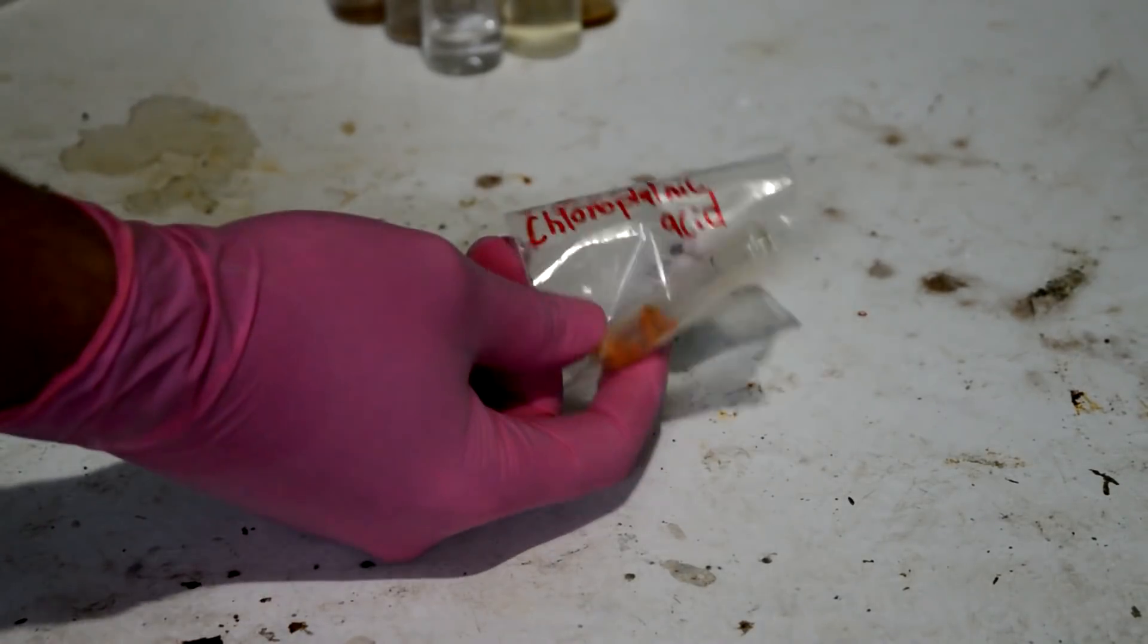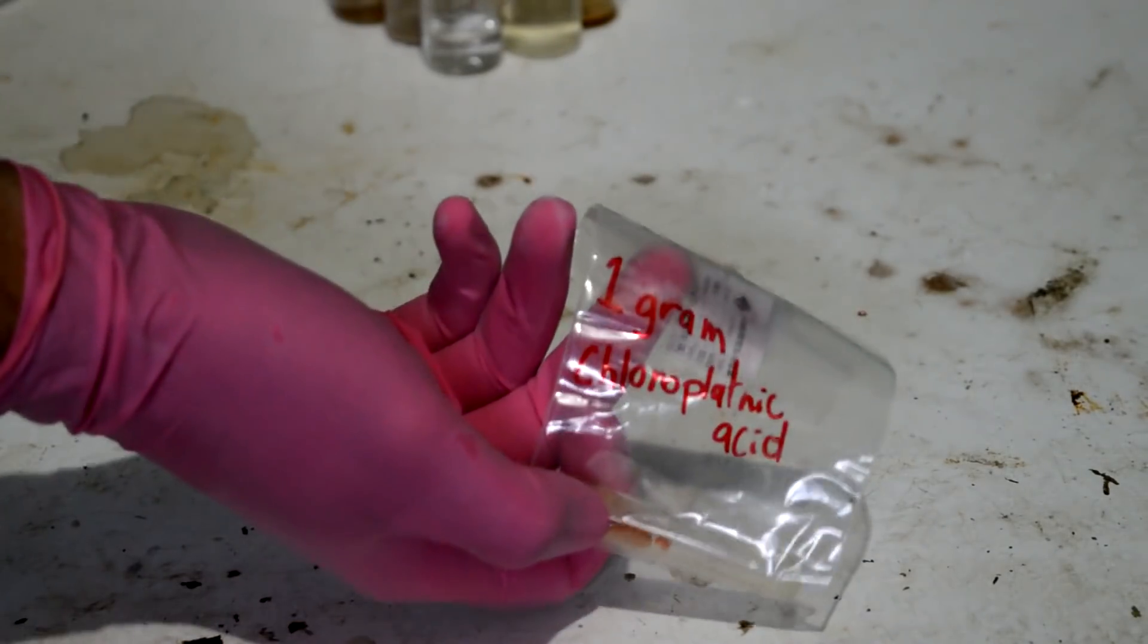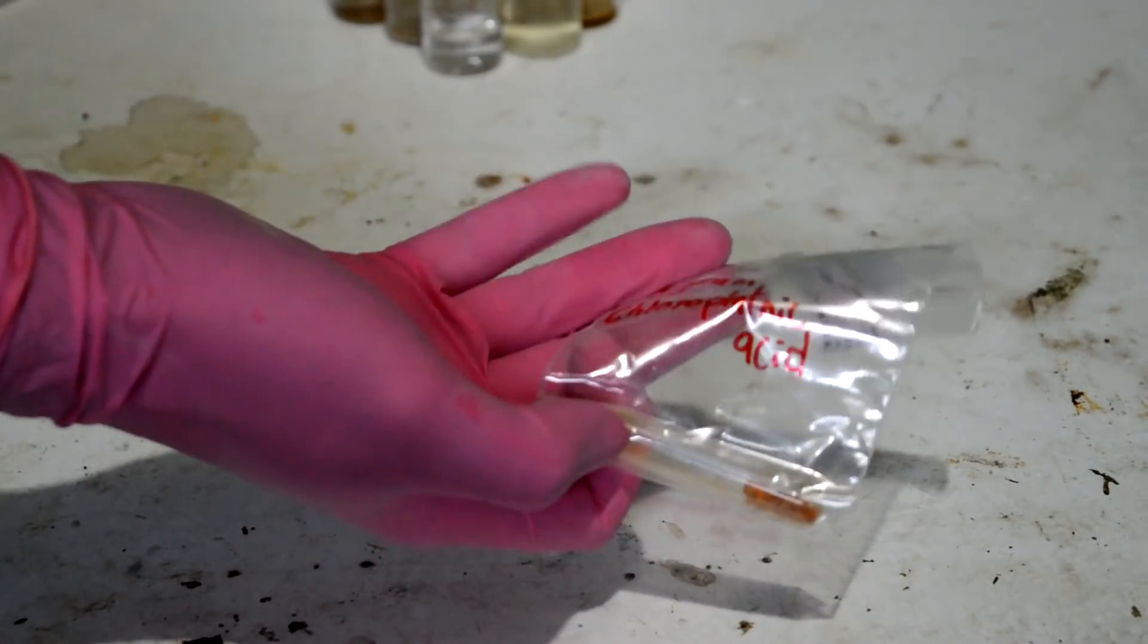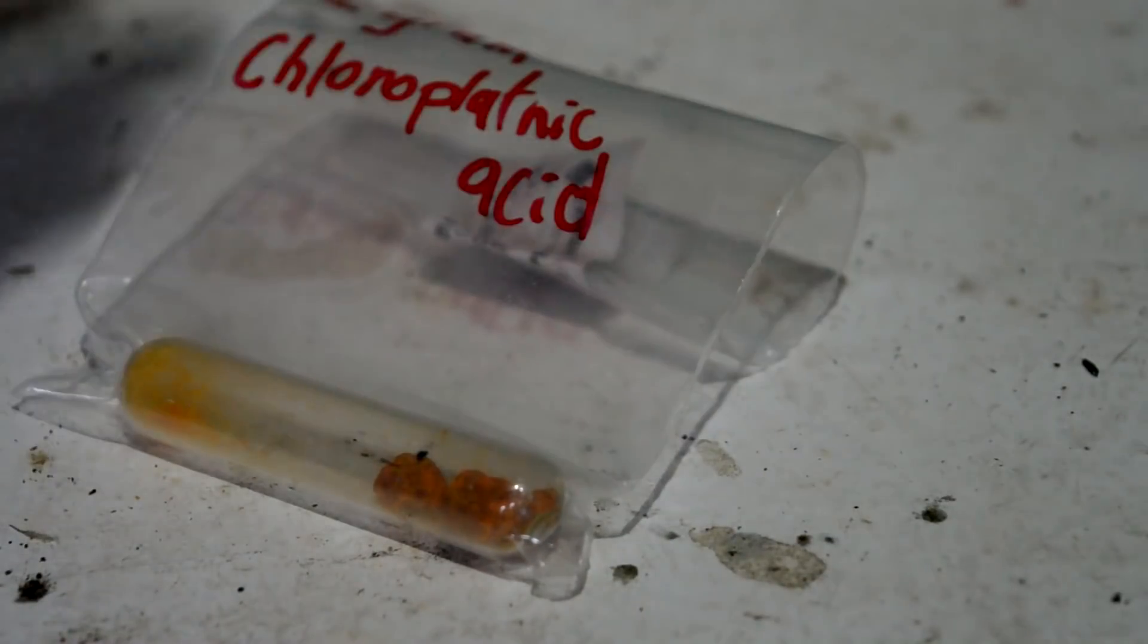Platinum only makes up a mild percentage of this. It's not pure platinum. Chloroplatinic acid is very, very hygroscopic. So as soon as I break it out of this container, it's deliquescent or whatever the level up from hygroscopic is. It'll quickly pull water and go into solution.